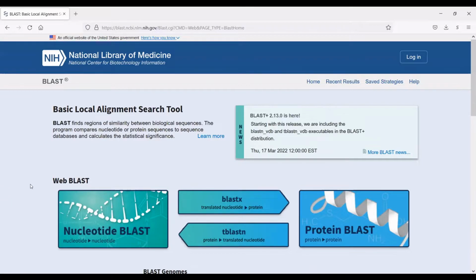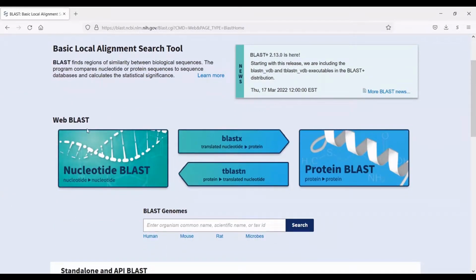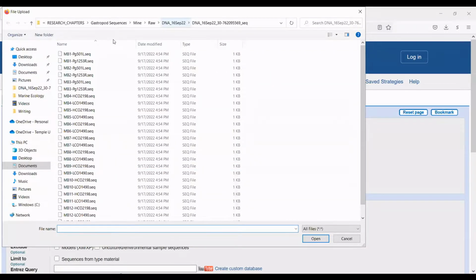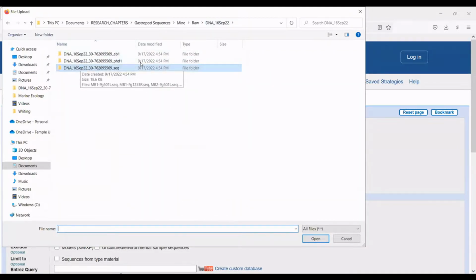So we are going to conduct a basic local alignment search tool within NCBI. And so we're going to conduct a nucleotide BLAST, which will search the NCBI database, NCBI being the National Center for Biotechnology Information. And we're going to see if the sequences that we've got are the ones that we are targeting. So we want to go to the DNA folder, and I'm going to go into the sequence folder.